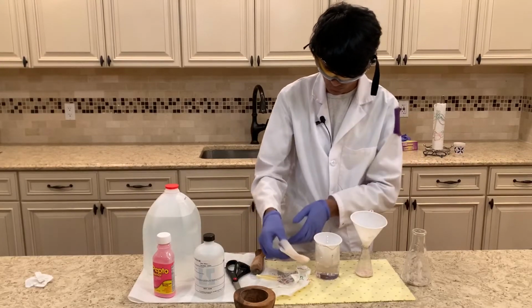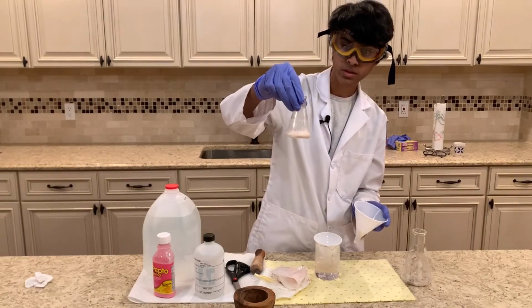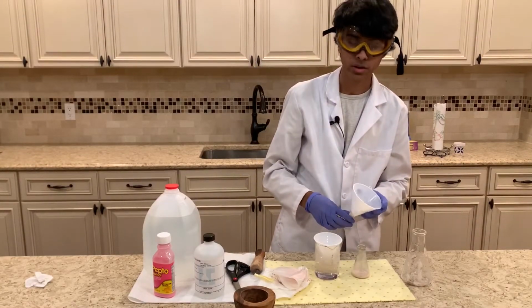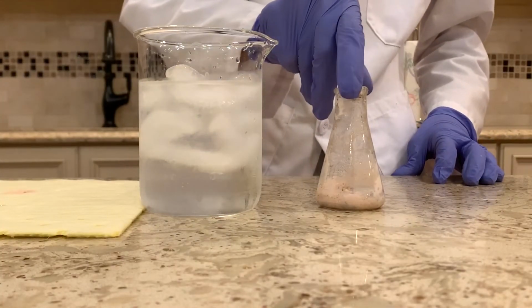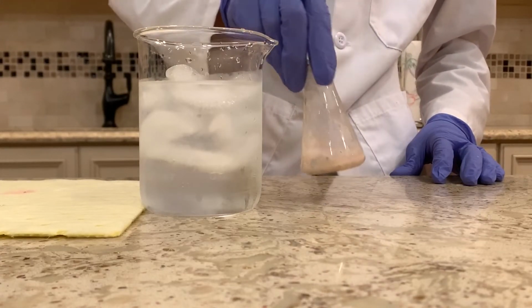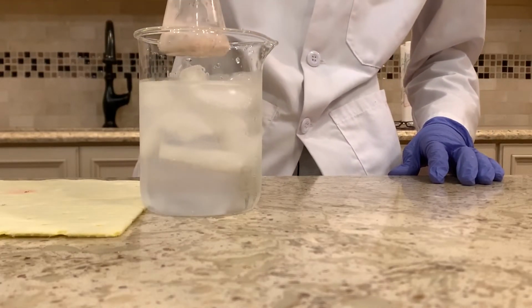Okay, and as you can see, it's this pinkish goop, and there are some aluminum foil bits in it. And I'm just gonna go heat this up now. So I heated up the bismuth for a little bit, and now it's back to a thick liquid form, and I'm gonna put it into the cold bath, and it should go back to its solid form.